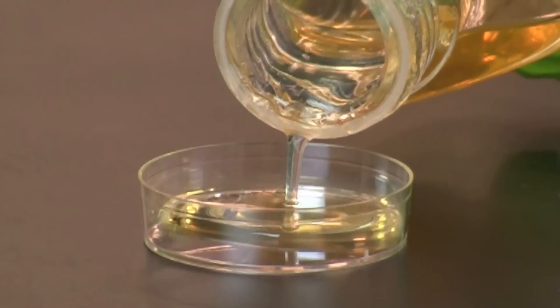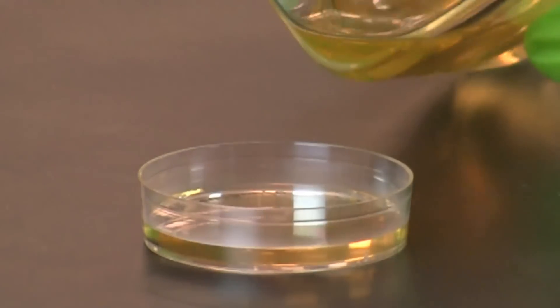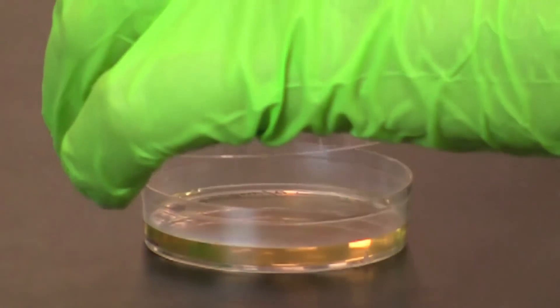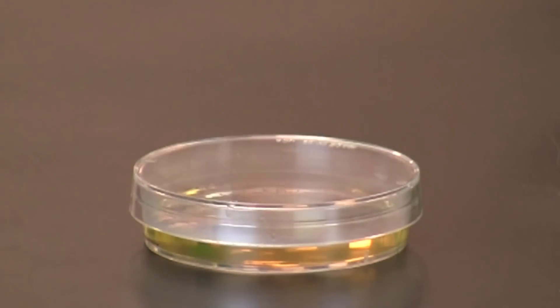Add enough agar to cover about one half of the bottom of the plate, and then allow the agar to flow and cover the whole plate. Make sure the plate is about one third full.